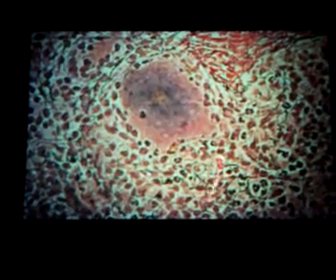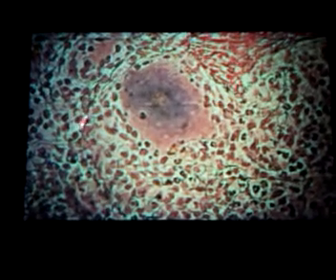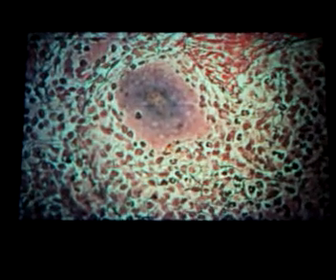Trabecula, red pulp, white pulp around here, white pulp around here, showing you the reticular fibers in the system. The more reddish cells on this one are the macrophages, the dark ones are still the lymphocytes. It's a little bit different staining situation because we wanted to show the reticular fibers. Now if you get up here, there are thin cells, that's going to be your fibroblast again. Little triangle piece right here, that is a fibroblast.